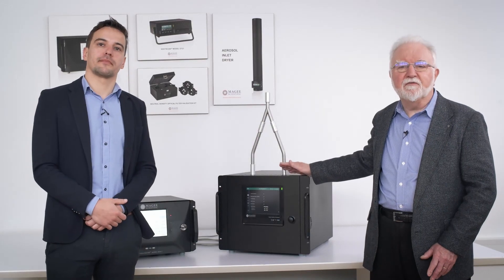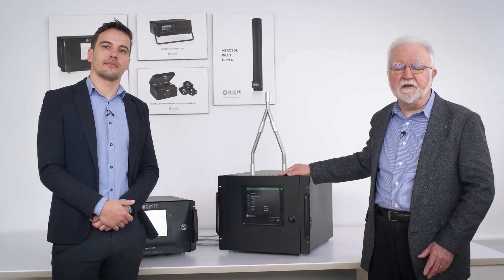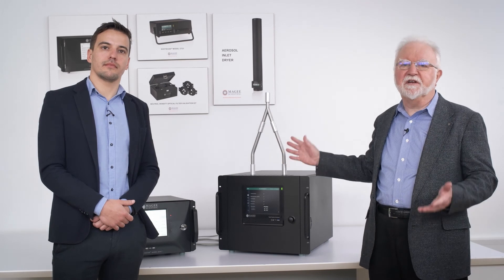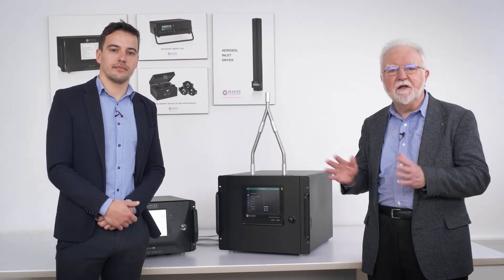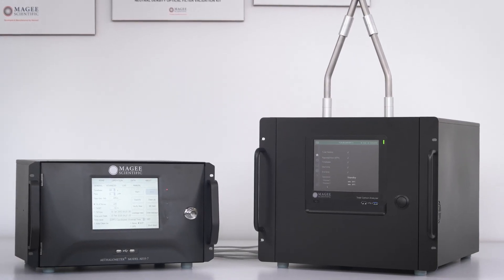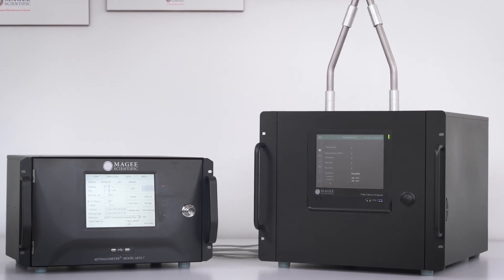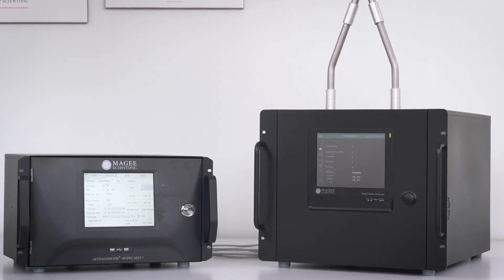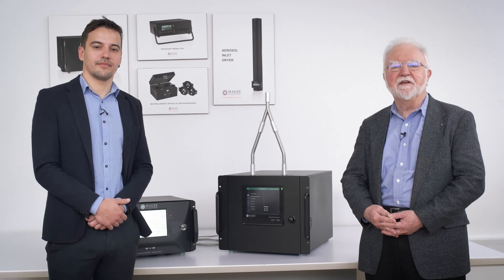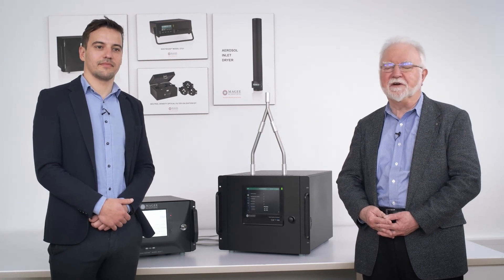The equipment is rugged, reliable, made of stainless steel, and does not require supplies of any specialized gases. This combination is ideal for research and monitoring under all conditions. For further information, please contact us. Thank you for your interest in our products.